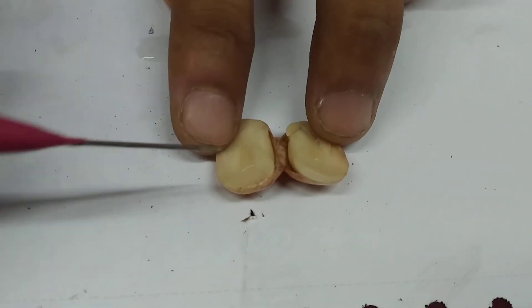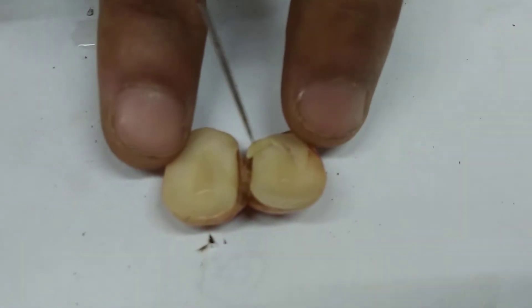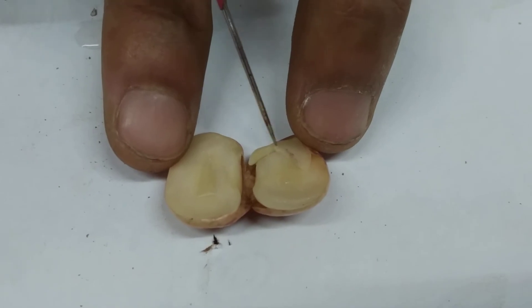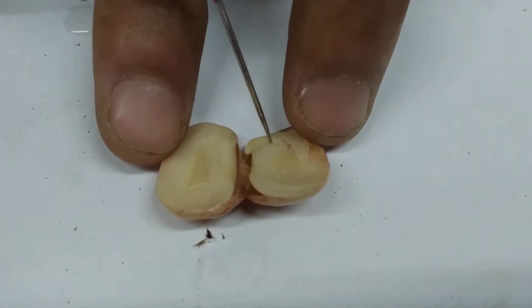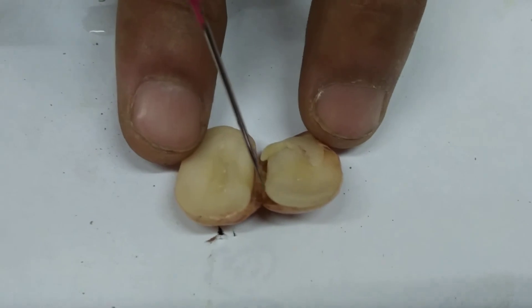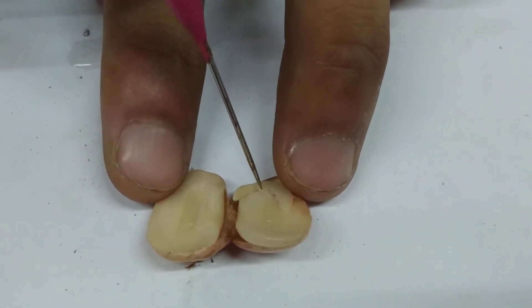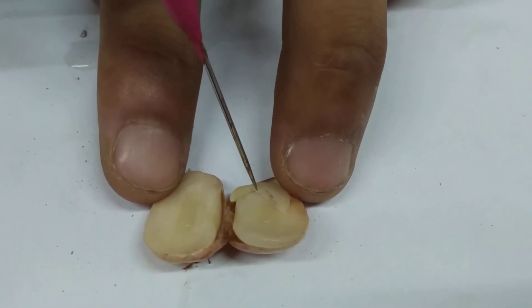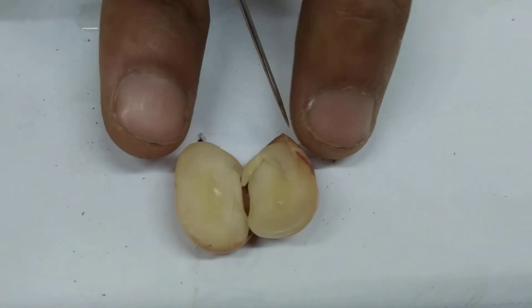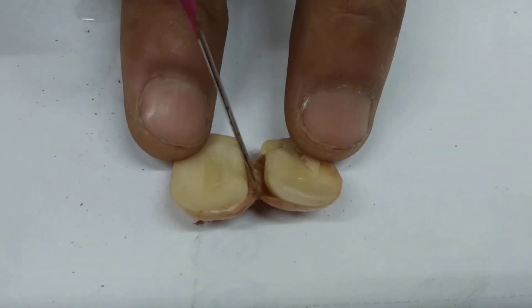If you look properly, this brownish portion is your seed coat. This over here represents your plumule, this represents your radicle, and these portions represent your cotyledons. Your plumule gives rise to the shoot system and your radicle gives rise to the root system. So this is basically what you study about your bean seed — the two cotyledons and the seed coat.